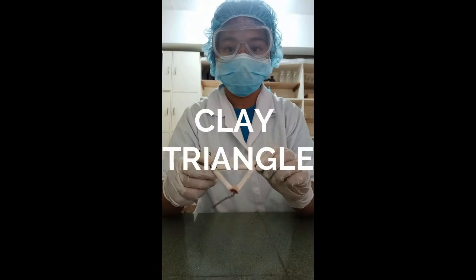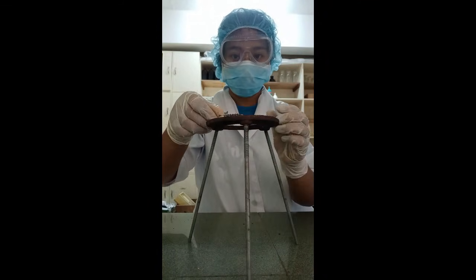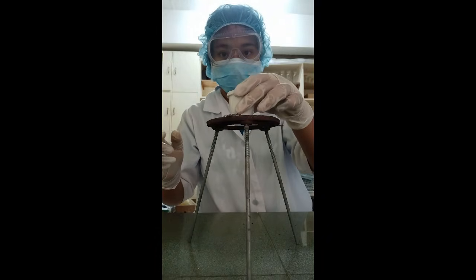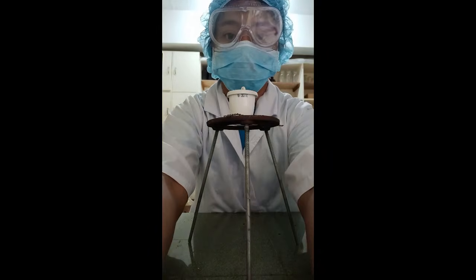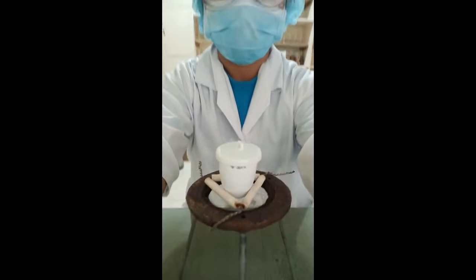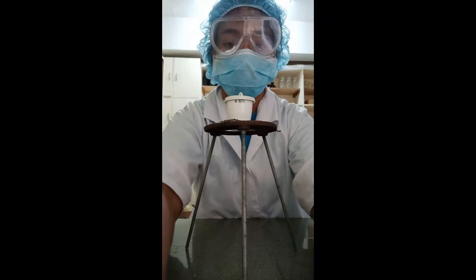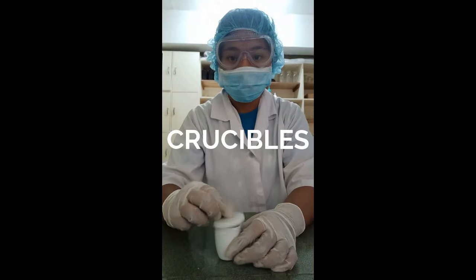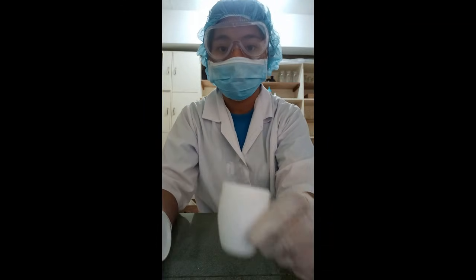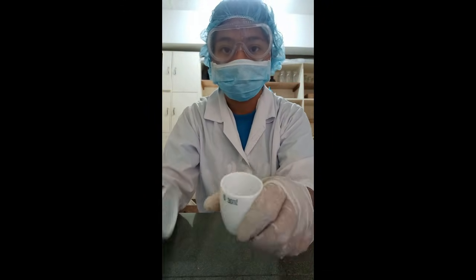Clay triangle. It is made of clay with an open center, used to suspend crucibles. Crucibles. It is a small clay cup made of a material that can withstand extreme temperatures and is used for heating substances.